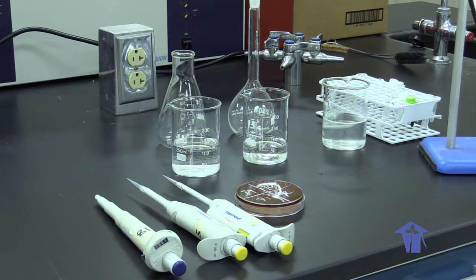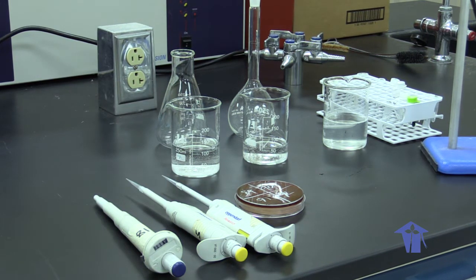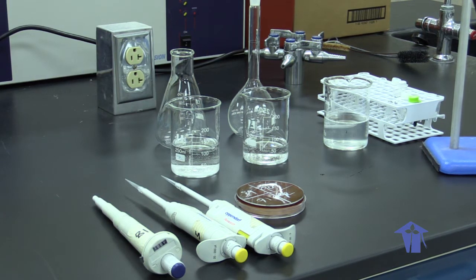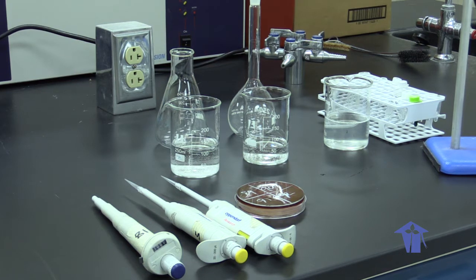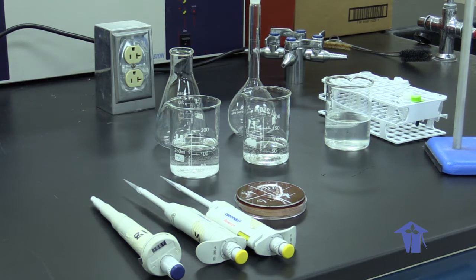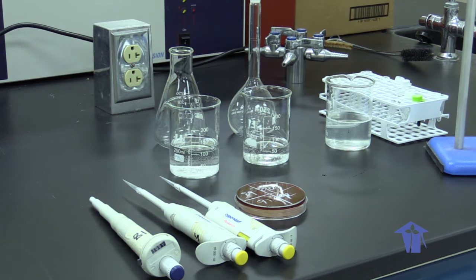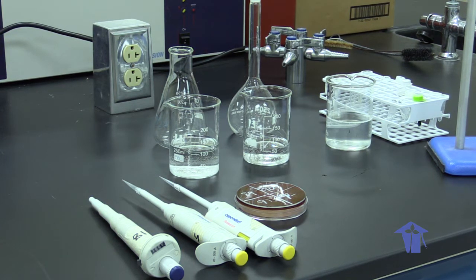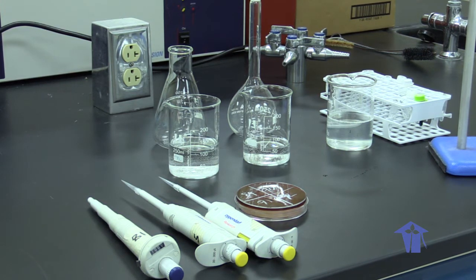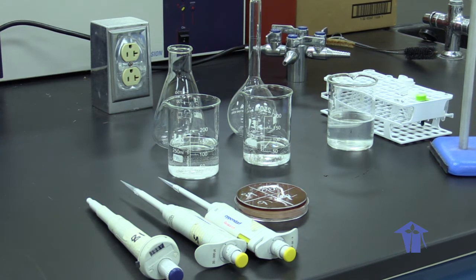The first step that we use in the analysis of DNA is the extraction of DNA from our cells of choice. Today, the cells of choice that we would be using would be gram-negative bacterial cells. The basis for the extraction of DNA is the removal of any item from the cell that is not DNA. That is, we would be removing proteins, we would be removing lipids, and we would be removing RNA from the cell until we are only left with DNA.